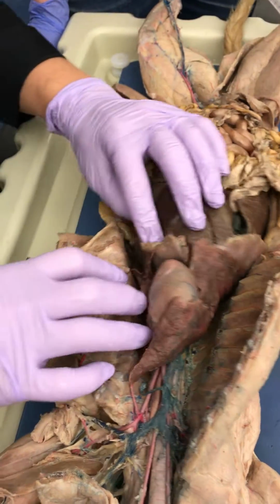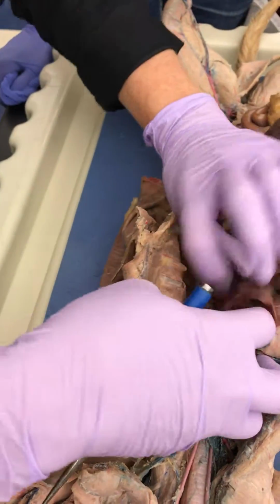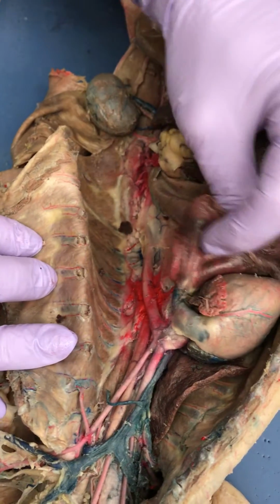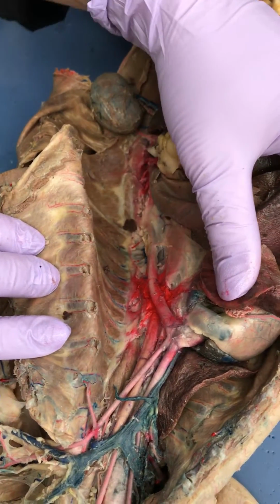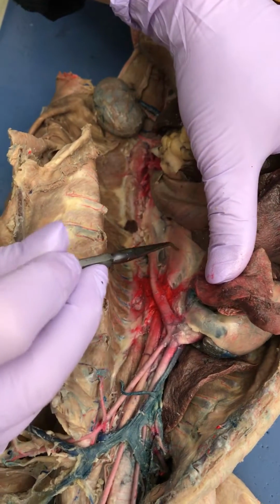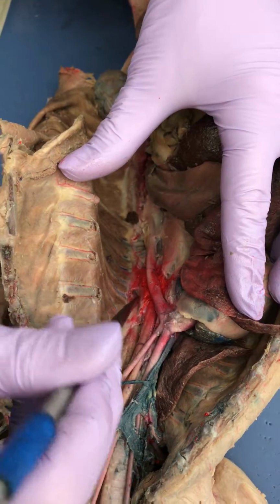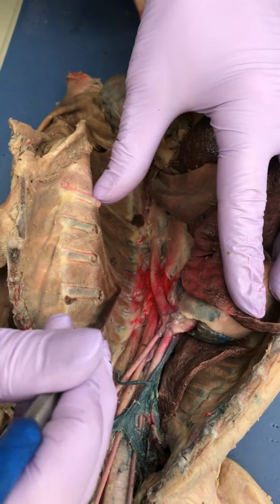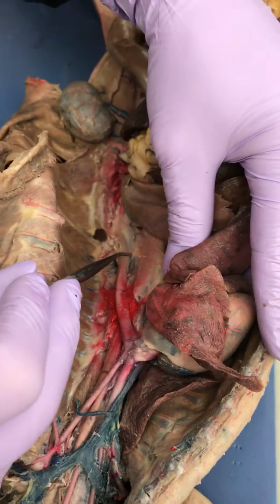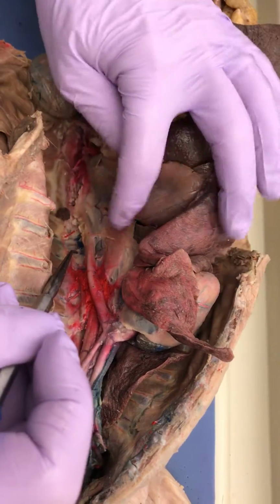And then most of the time we roll to the left because the left gives us that really great view of the aorta and the esophagus. Yeah. So most of the time we spend with this view. And you can see the aorta coming down. There's the esophagus. All right, the little arteries that are coming off of the aorta to do the ribs are called intercostals. And then the little arteries that are coming off to go to the esophagus are called esophageals.